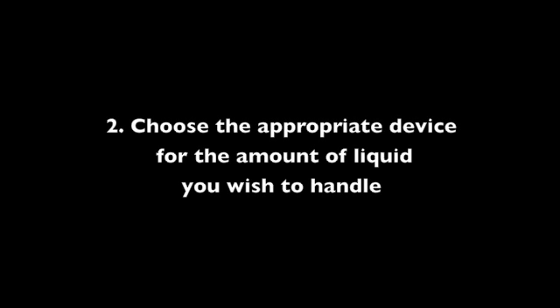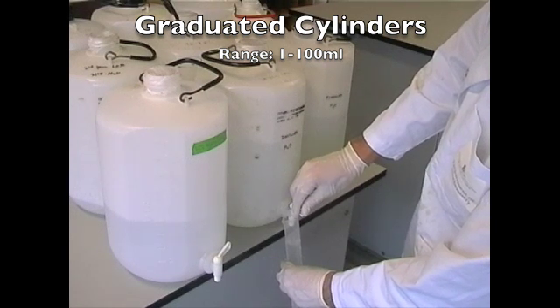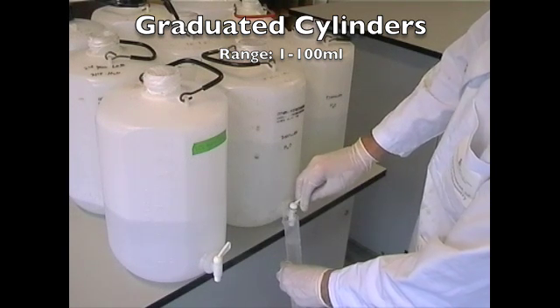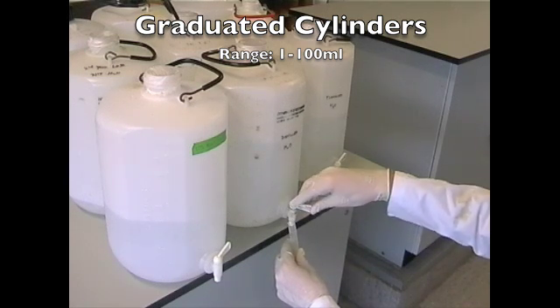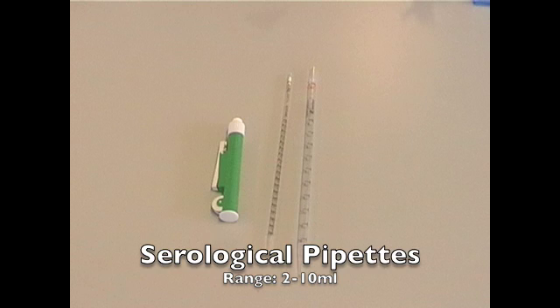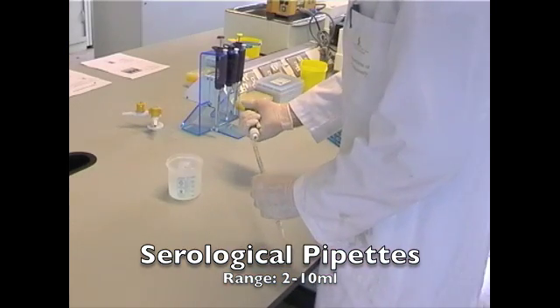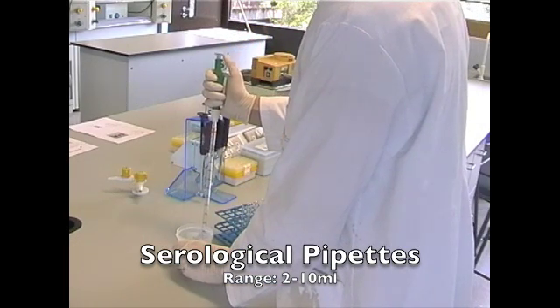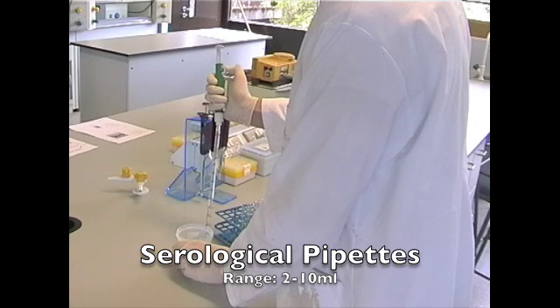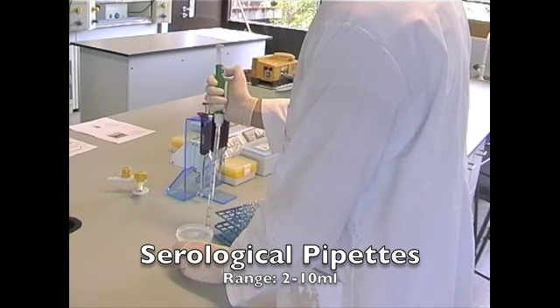When dealing with liquids, it is crucial that you choose the appropriate device for the amount of liquid you wish to handle. Graduated cylinders are used to accurately measure out volumes of chemicals for use in reactions; they are generally more accurate and precise for this purpose than beakers. Serological pipettes have a range of 2 to 10 milliliters. They are filled by attaching a pipette filler to the top of the pipette, immersing the tip in the liquid, and rotating the wheel until the desired volume is within the chamber of the pipette. They are emptied by rotating the wheel in the opposite direction.